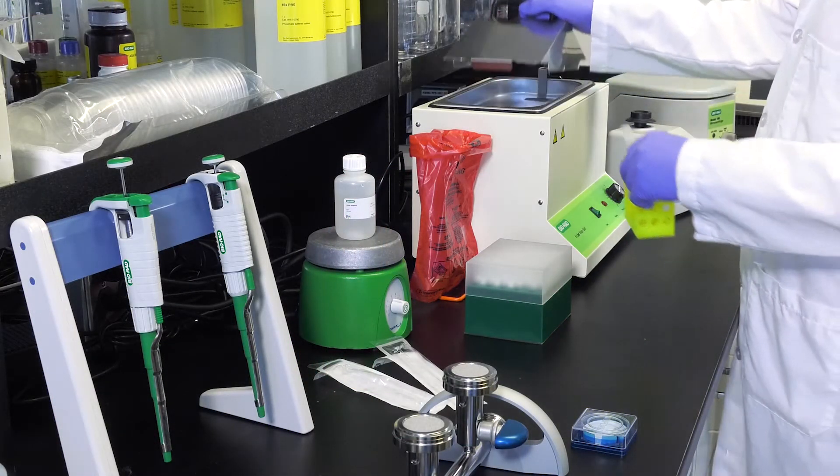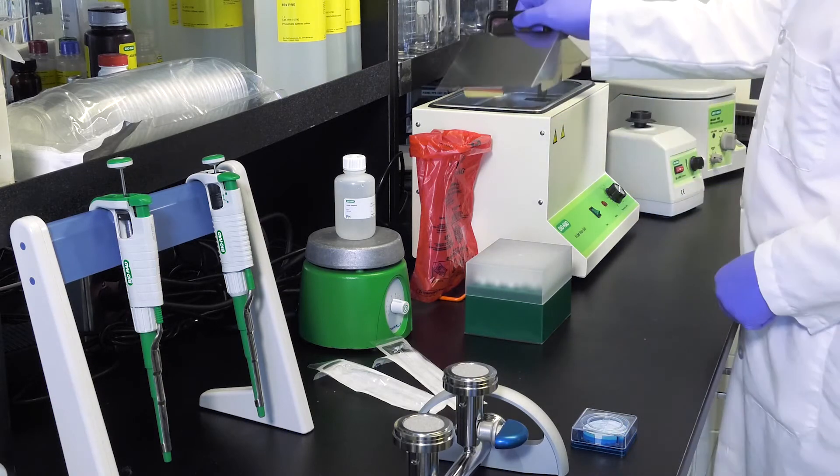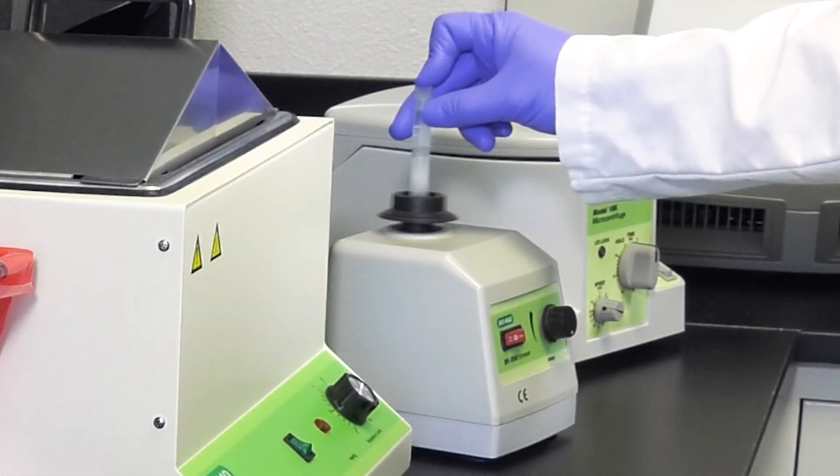Incubate for 15 minutes at 95 ±5 degrees Celsius in a water bath and then vortex again for 20 seconds.